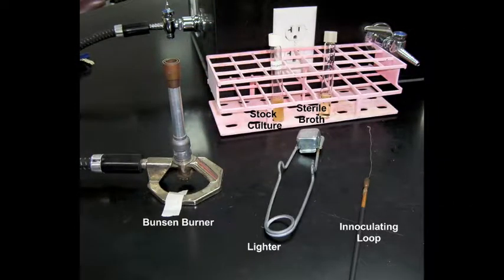Assemble all of the equipment that you'll need for your experiment. In this case, a stock broth culture, a tube of sterile broth, an inoculating loop, Bunsen burner and lighter.